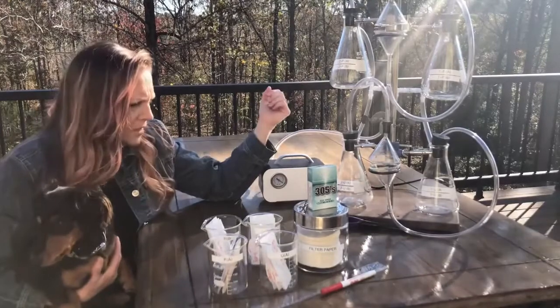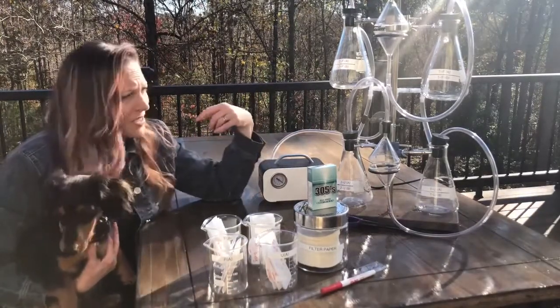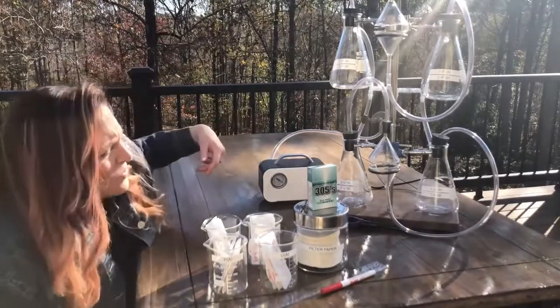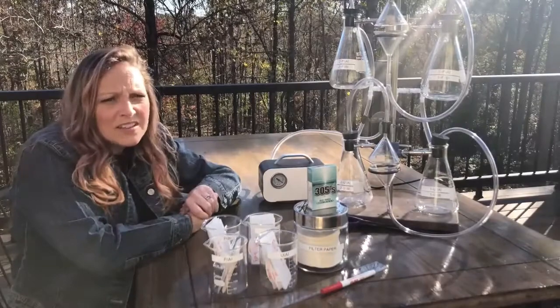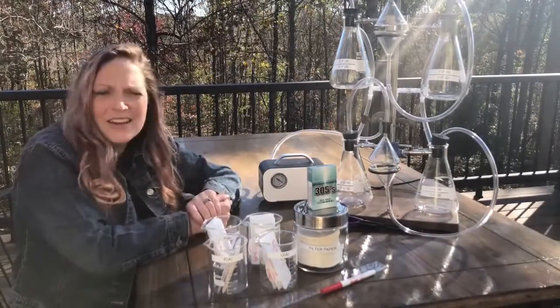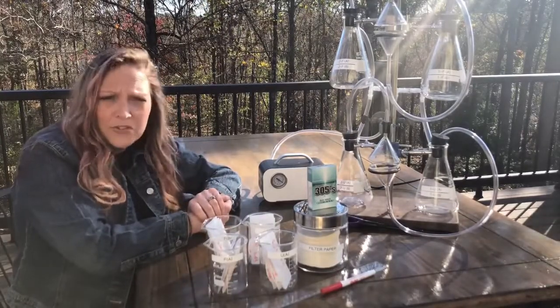Now, when we were growing up, your parents and me, people our age, smoking was everywhere. So smoking is a lot less common these days, and it was actually really hard for me to find any unfiltered cigarettes. So I kind of had to doctor some. I took a filtered cigarette and I pulled the filter off the end.